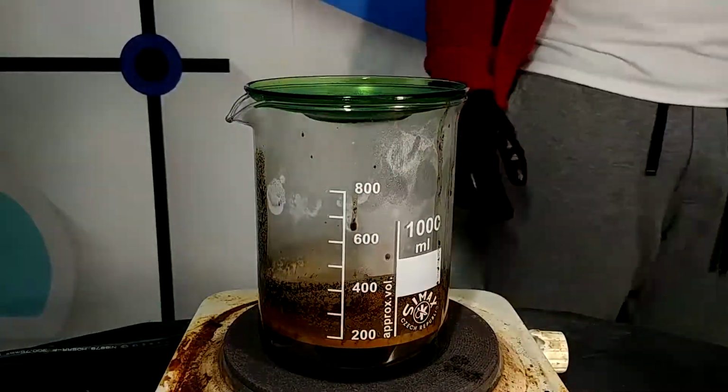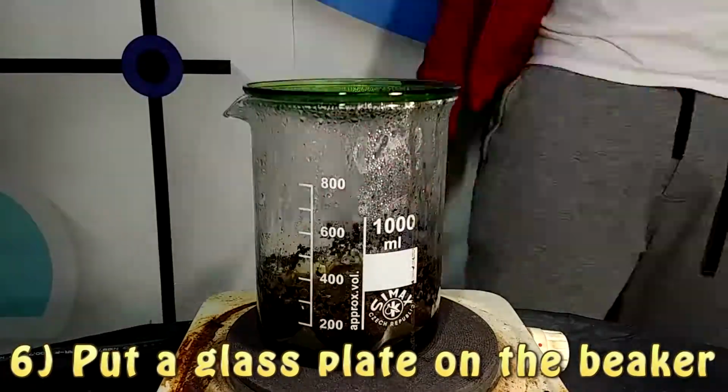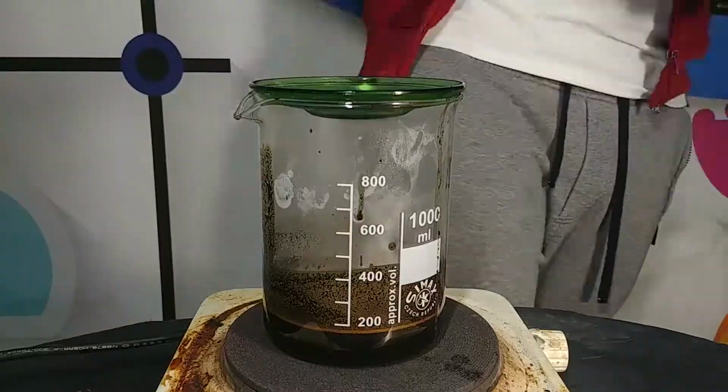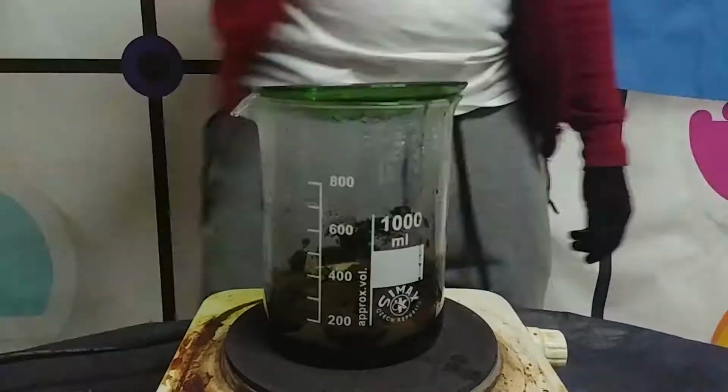So the next thing that we're going to do is to let this liquid boil for about 15 minutes, and then we're going to put a watch glass on it in order to maintain the water. In this way the water in the solution does not evaporate, and so we can be sure that the liquid is contained in our beaker.